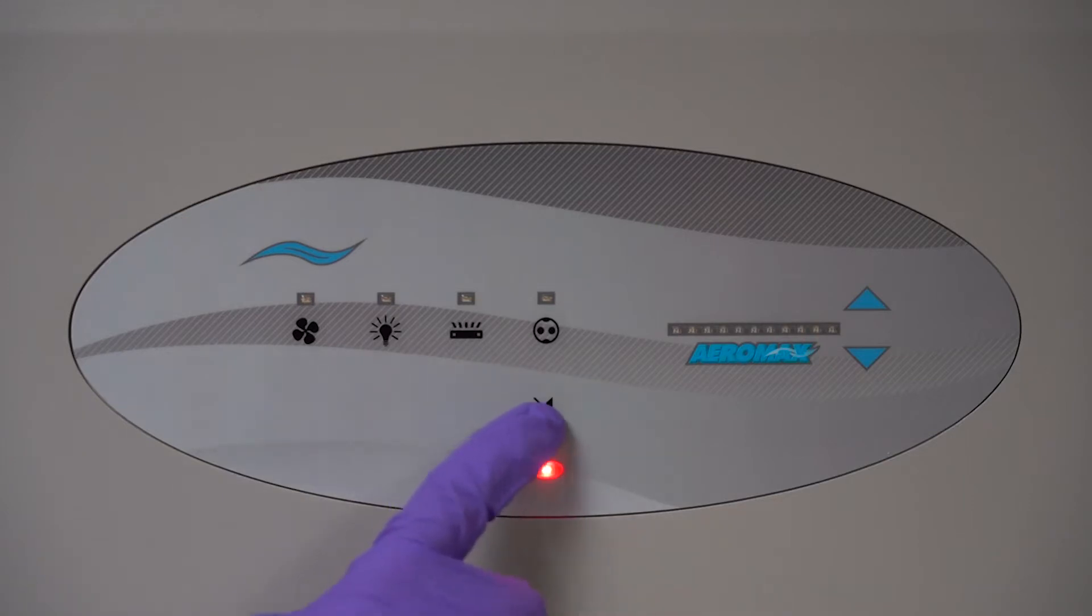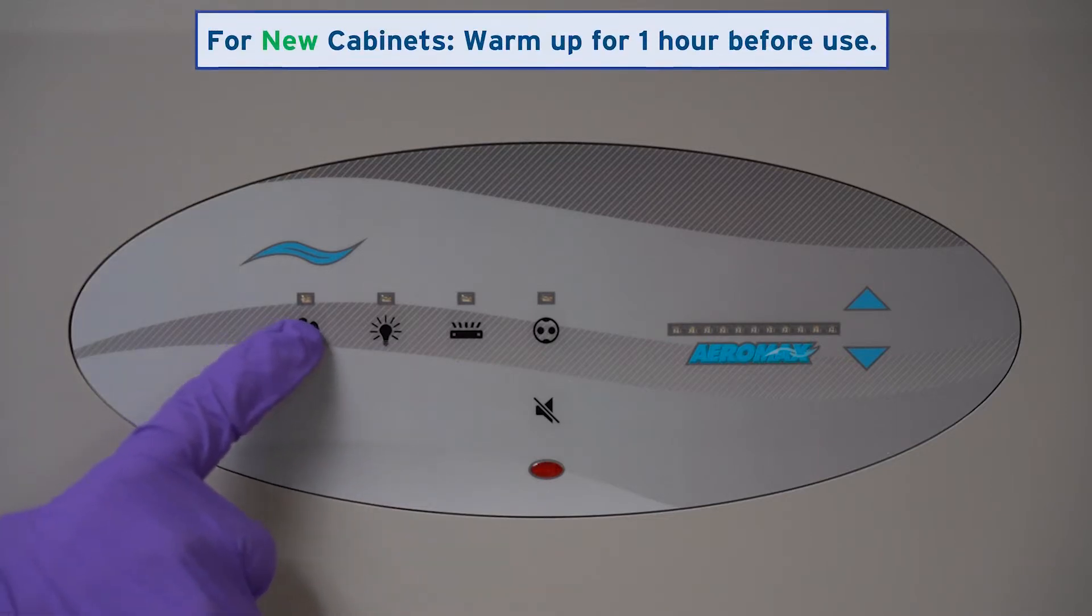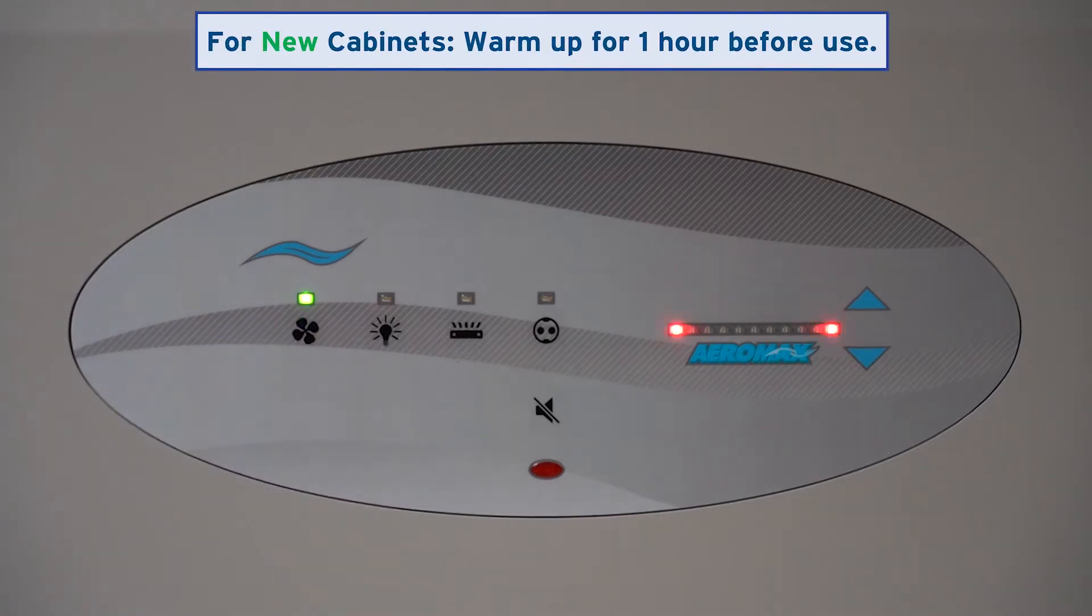Silence the power reset alarm. Activate the cabinet blower. The cabinet will now warm up.